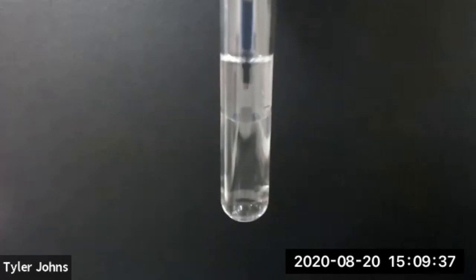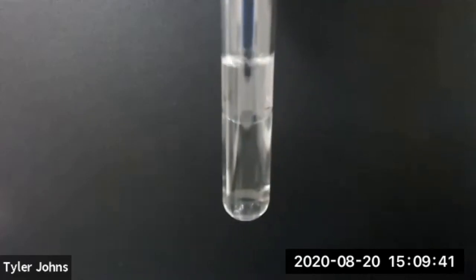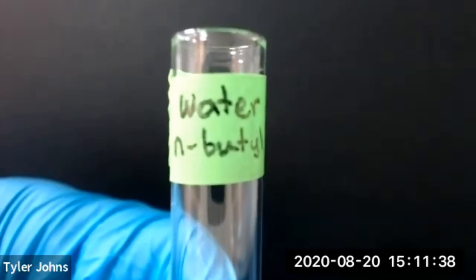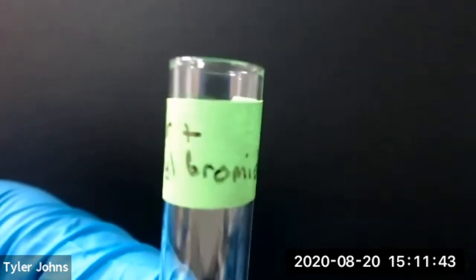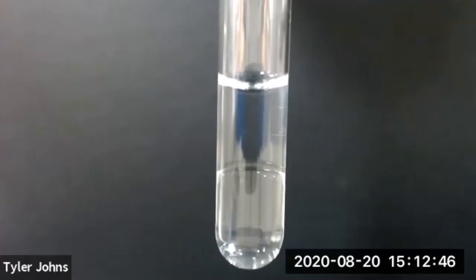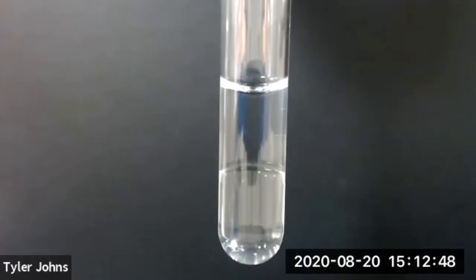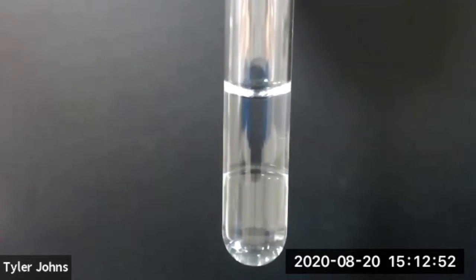Note which layer has gained volume when adding the water. Our second test tube contains water and n-butyl bromide. We'll now add several drops of water to our test tube containing water and n-butyl bromide.